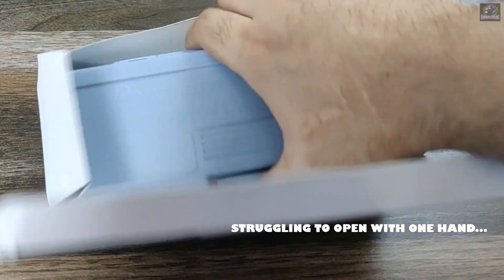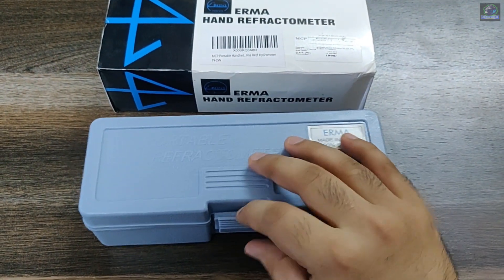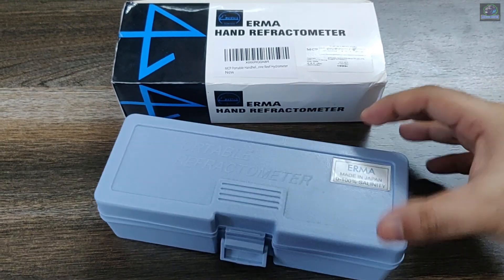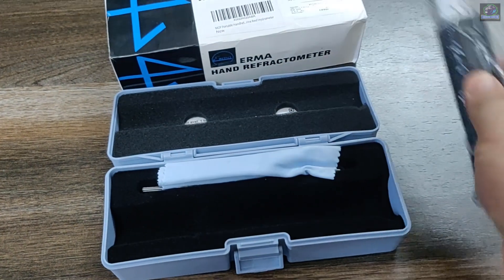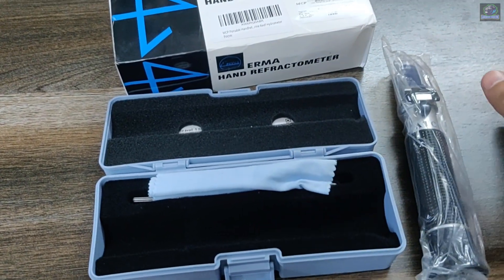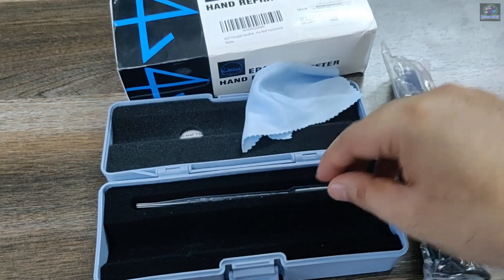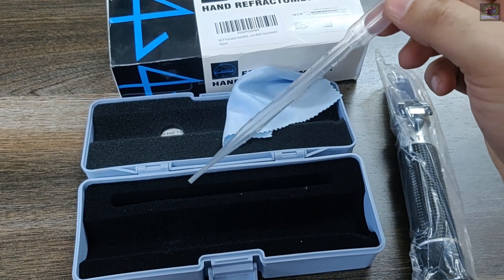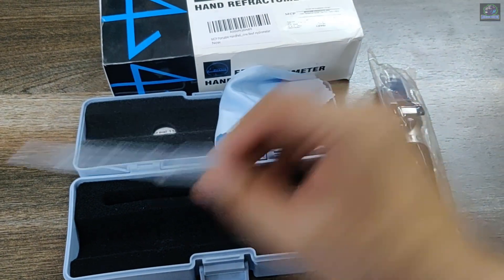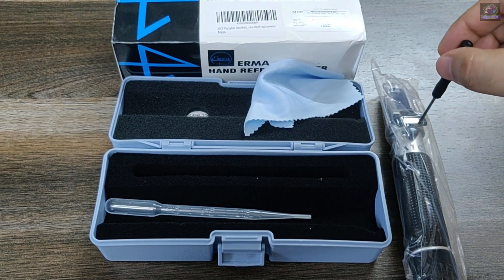Make sure you're getting the saltwater refractometer. It's a nice portable box that you get along with it. As I open the box, you will see here is the refractometer. What else comes with the box: a soft cloth to wipe the glass that measures the salinity, a dropper to take drops of salt water from your tank, and a screwdriver to calibrate the reading at the tuning point.